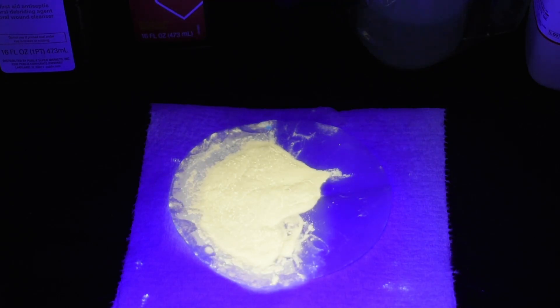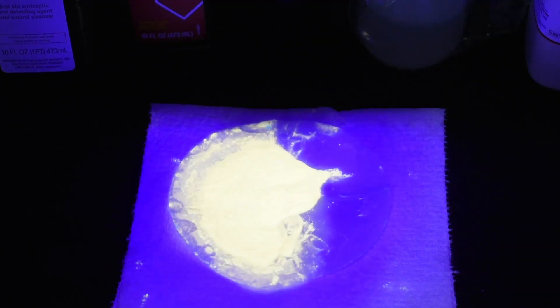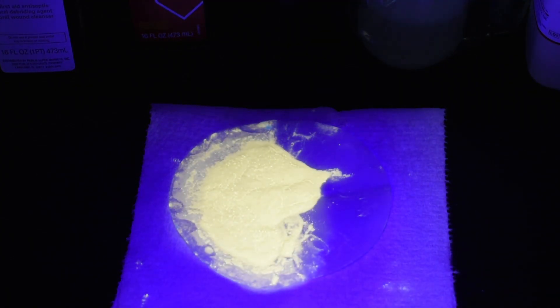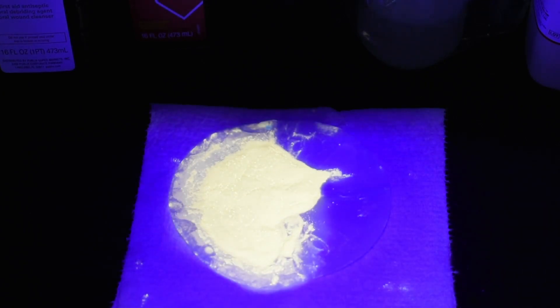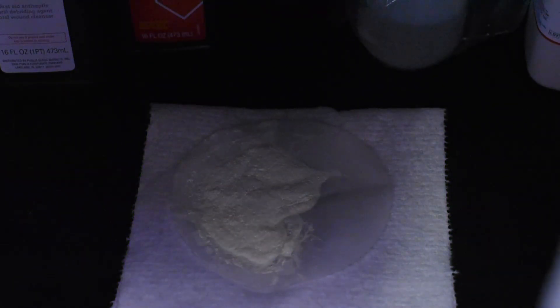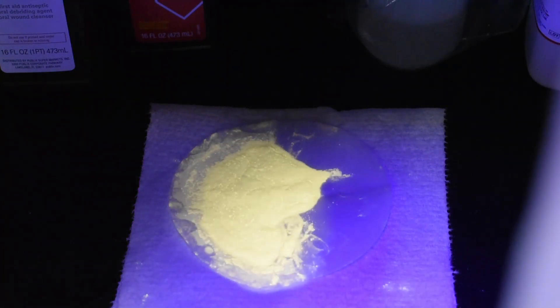And as you cool it down to liquid nitrogen temperatures, it fluoresces blue, so it's got that thermochromic fluorescence. But I do not have liquid nitrogen available. The next best thing is I'm going to try to put it in the freezer and see if the color changes at all. But I'm very happy with this result. Real nice yellow color there. There it is once again without the UV. And there's that beautiful yellow.